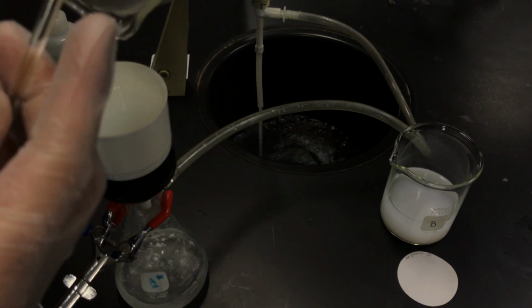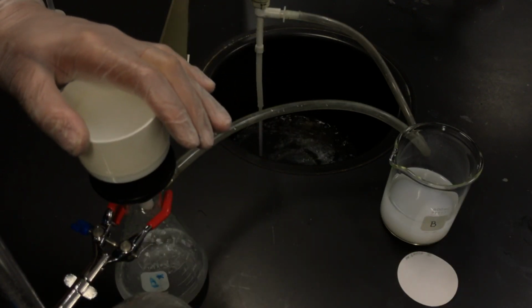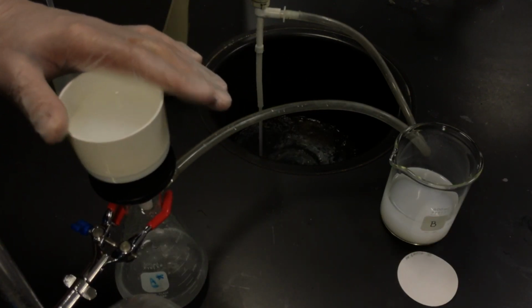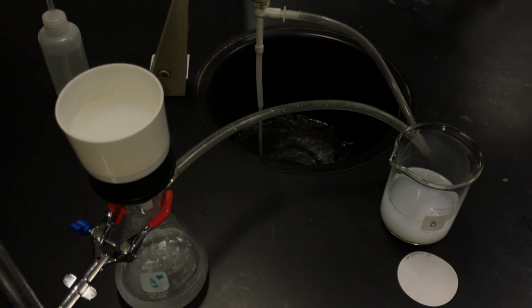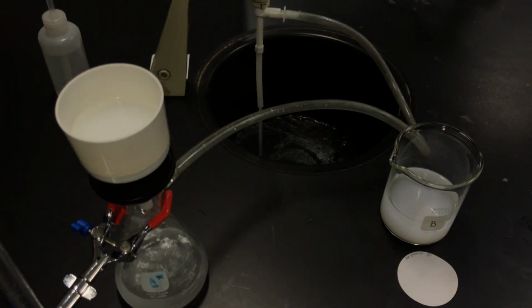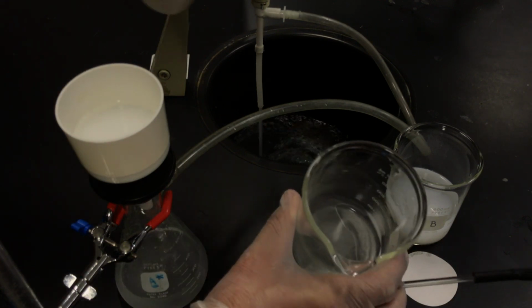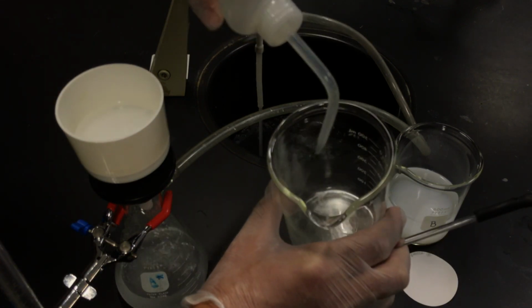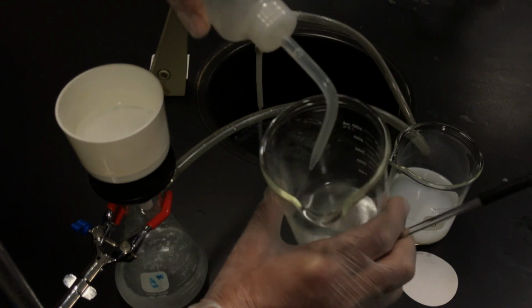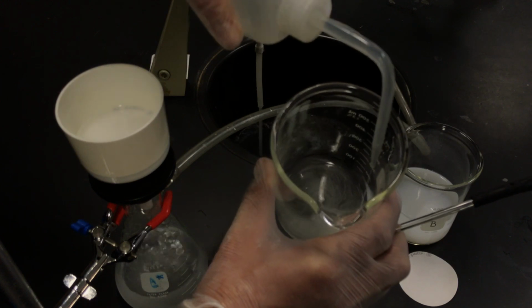And since it's vacuum filtration, just make sure that it's seated nice and tightly. I know I didn't quite do that beforehand, but all right. And it's pulling through, and as you can see, I still have some solids here. So, one thing I'll do is take my wash bottle, again made of distilled water with no ions, and wash this side up, give it some more fluid to get all of these solids out.